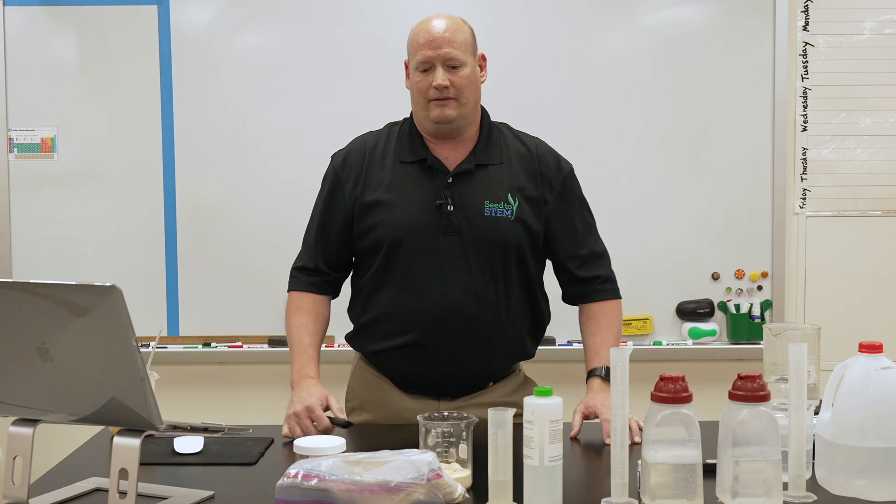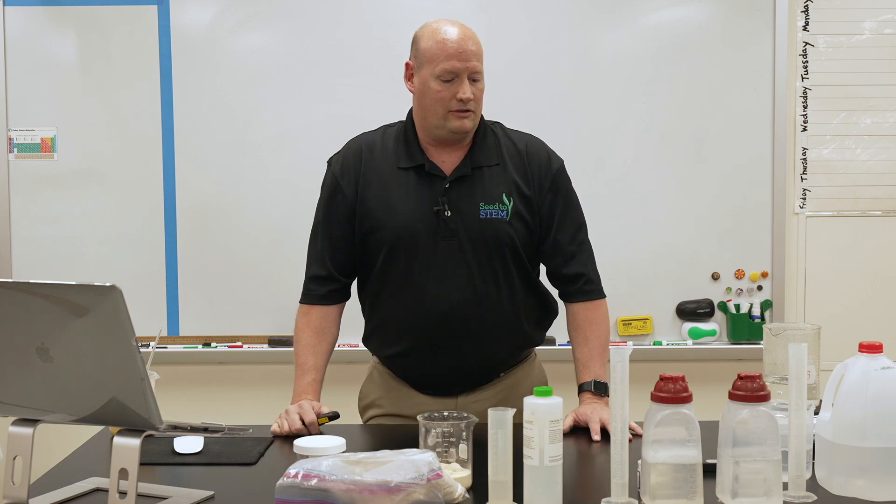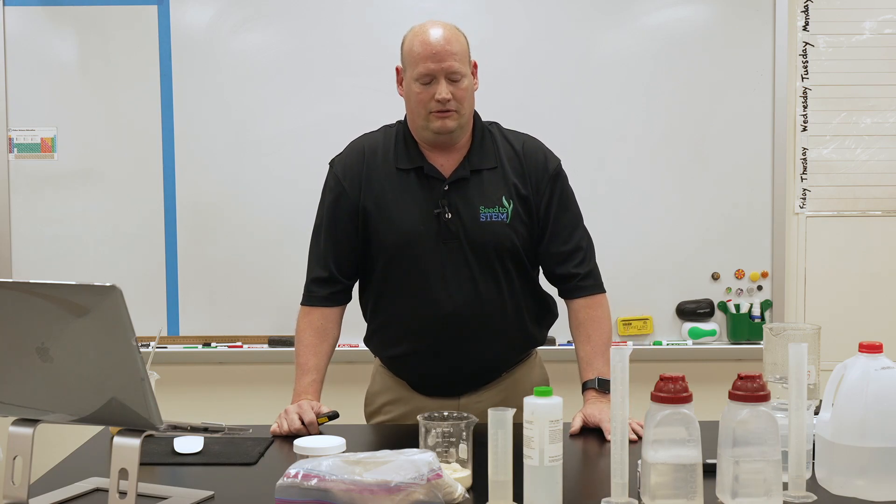The materials you need — this is actually a two-part lab. You can teach this as a standalone lab, which means you have to have a day of prep work for that, or you could teach this as a follow-up to our ethanol and distillation labs. This video is going to be designed to cover day one, the prep lab on how to get your grains ready in order to do the nutrient testing.